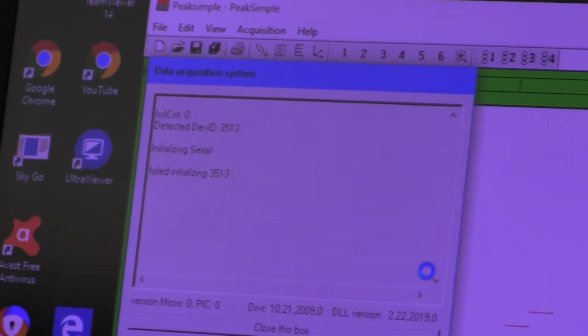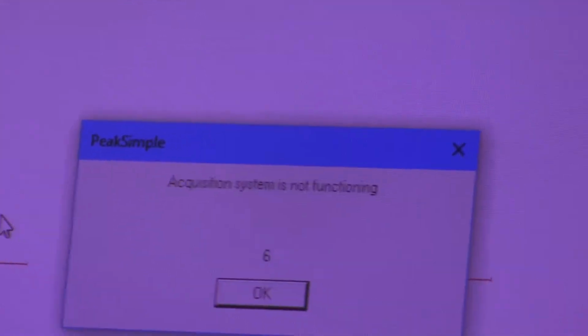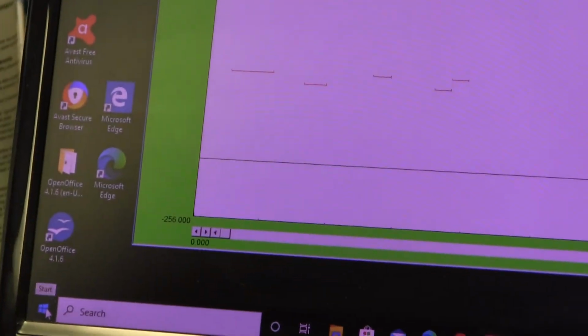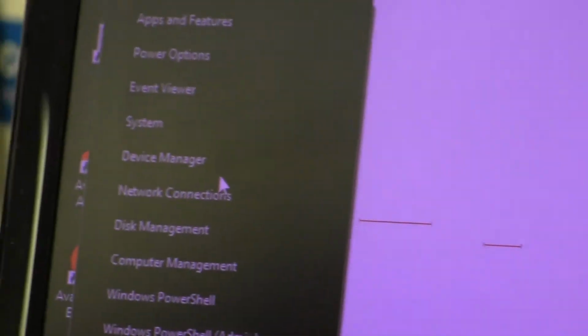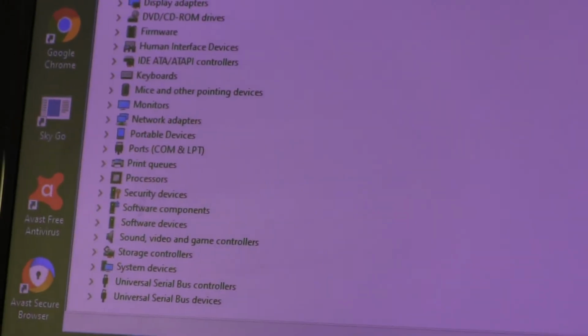So it's not able to connect, and the message that it gives you is important, because if it says failure to enumerate, ENUMERATE, failure to enumerate, it means that the driver didn't load properly. So to fix that, what we do is we go to the Device Manager screen. So the Windows Start button down here at the lower left, you can either right click or left click on that. If you right click, you get this menu that pops up, and then one of the choices is this screen called Device Manager. So you select that, and it takes you to a screen that looks like this.